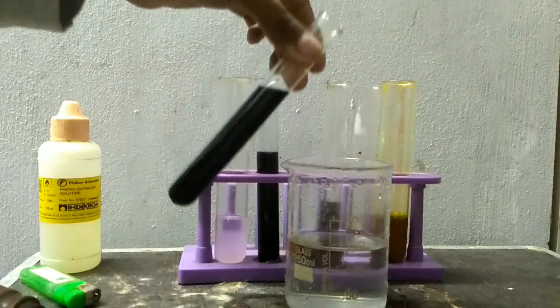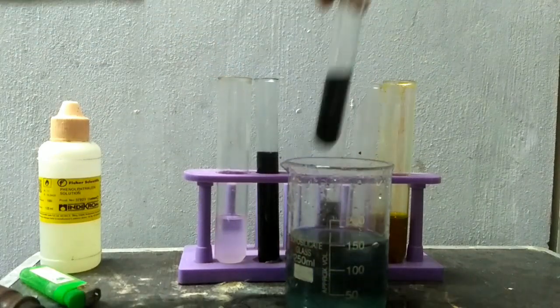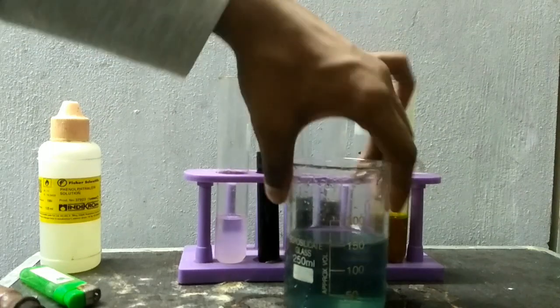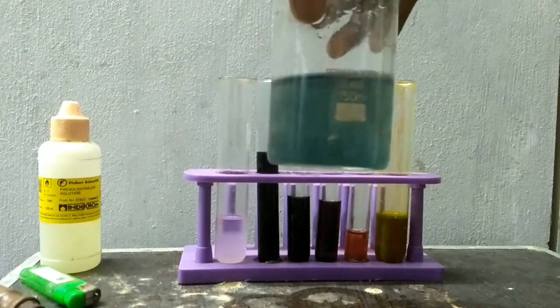Now this is alpha naphthol one. Green color.